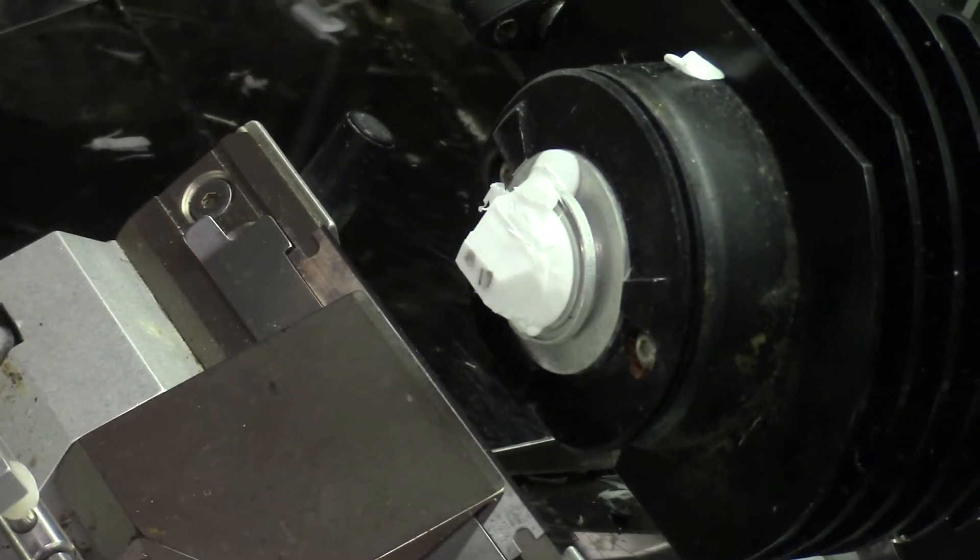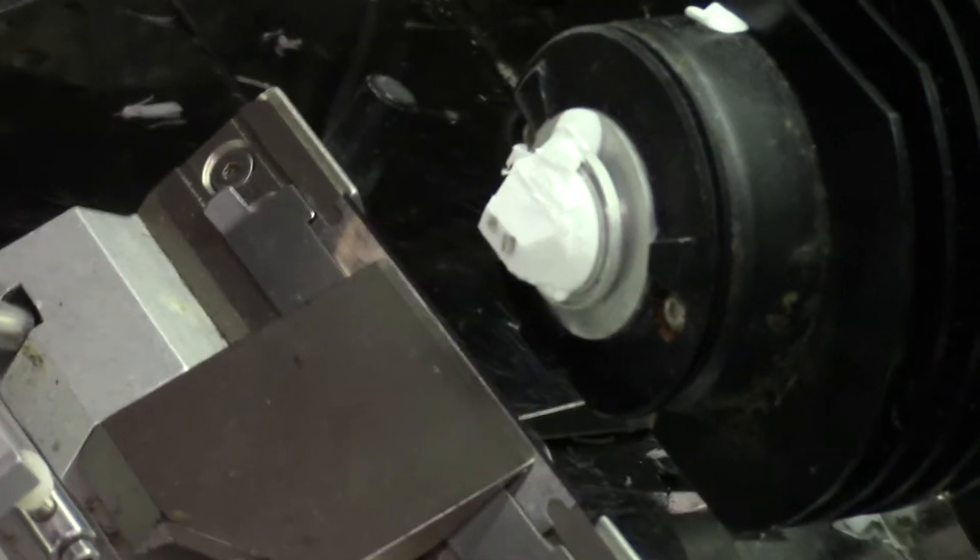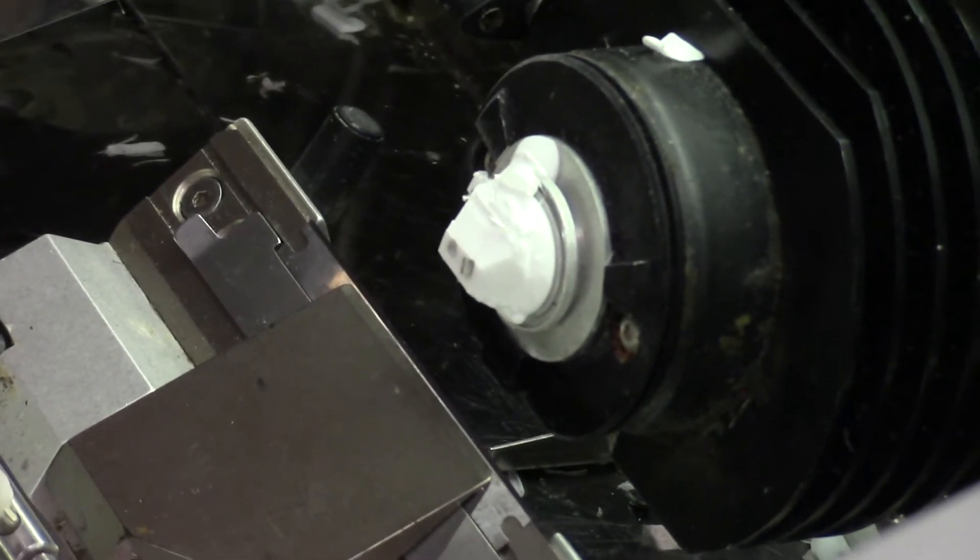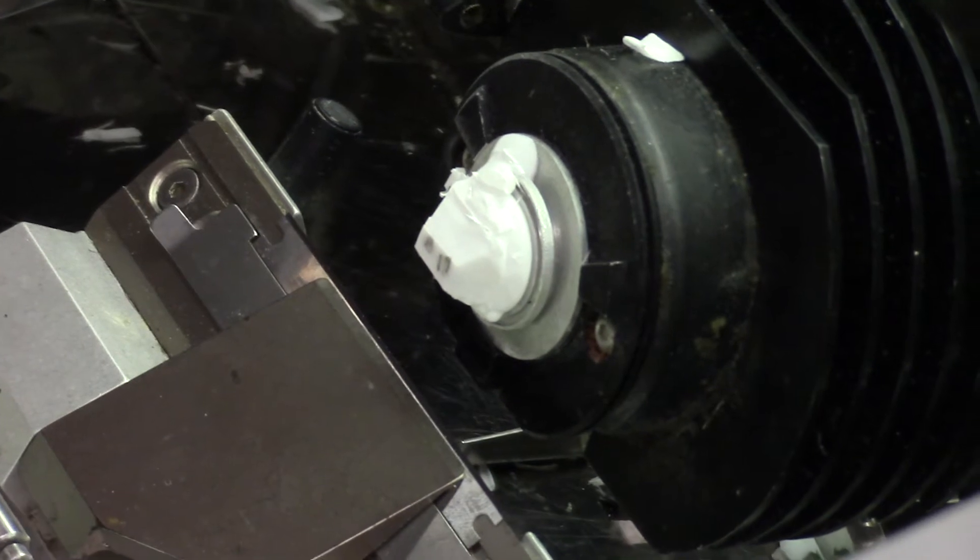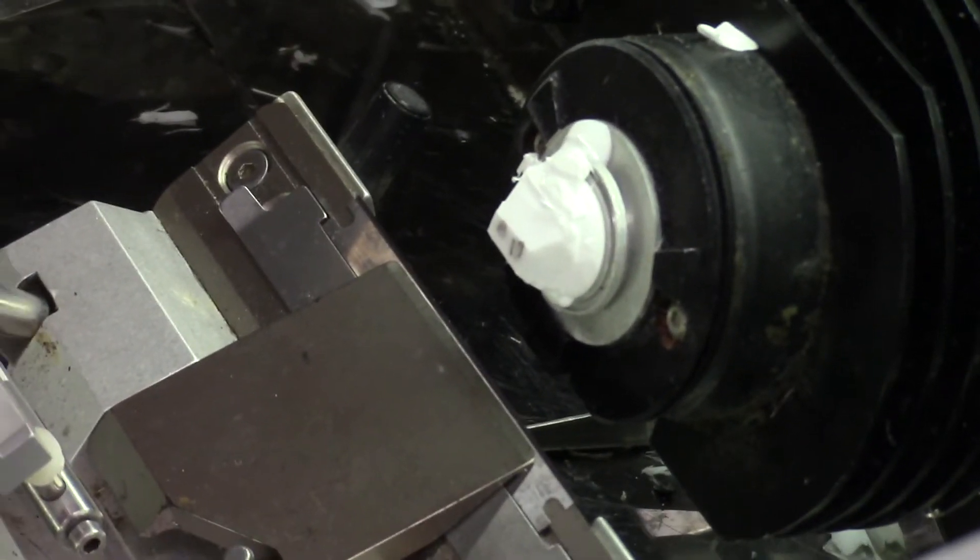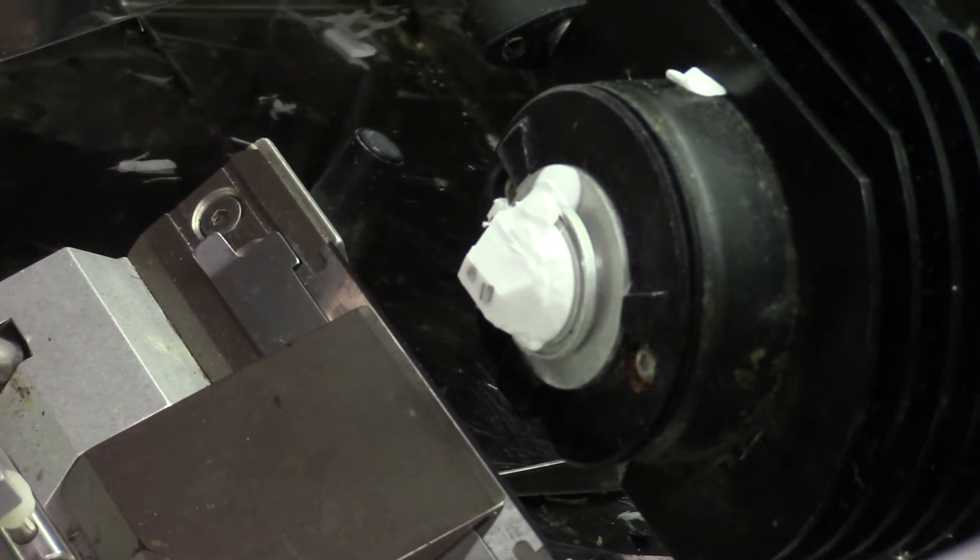We want to get more tissue sections onto more slides, and a block of tissue this big that's a millimeter long, we should be able to get 50 sections of 20 microns each. We should be able to fill up 10 slides easily, so let's try to save this.